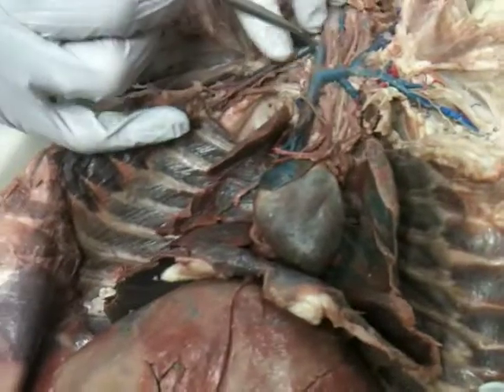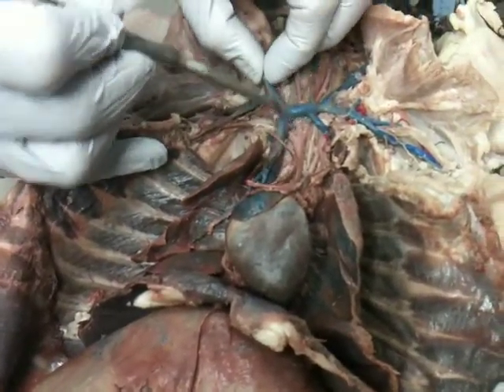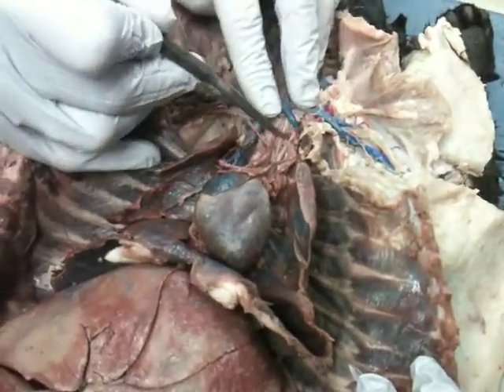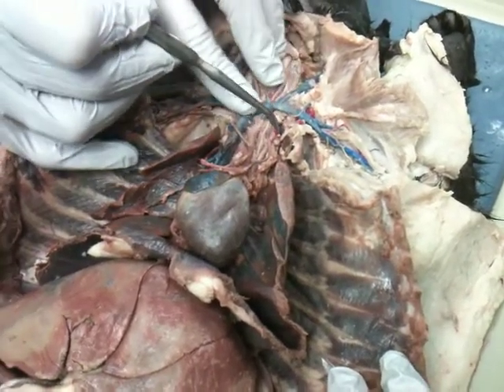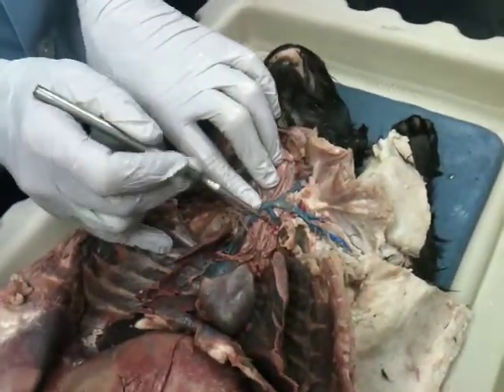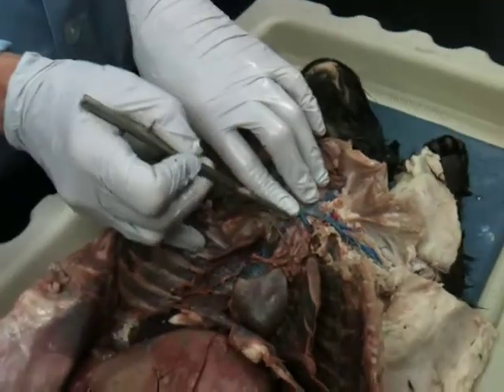And on this side, some cats show it better than others. So I will look on a different cat for that. This would be the vertebral going off that one. Okay. Again, that goes up the transverse foramen of the cervical vertebrae, if you remember that from last semester. Okay. So we've got the subclavian come along.